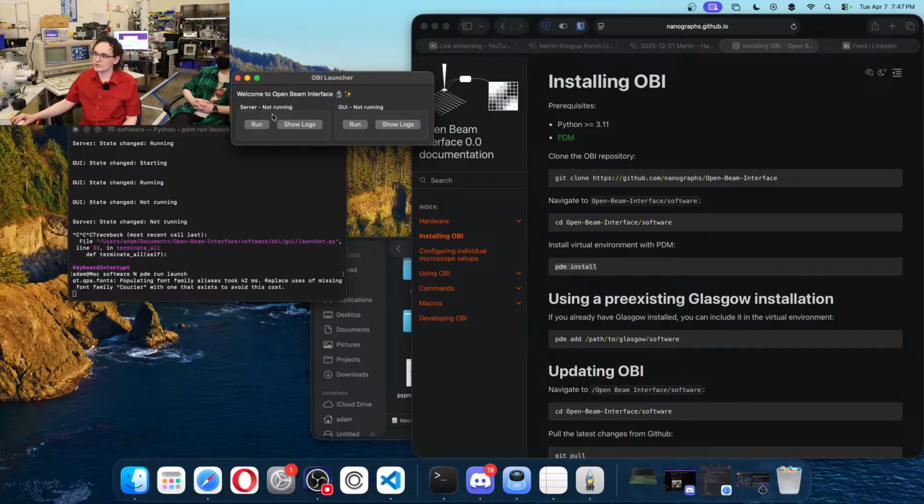And you can also individually, if you want to bring up two terminal windows, do pdm run server and pdm run GUI separately. That also works. This is just kind of a convenient tool.